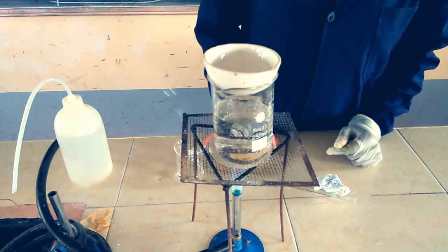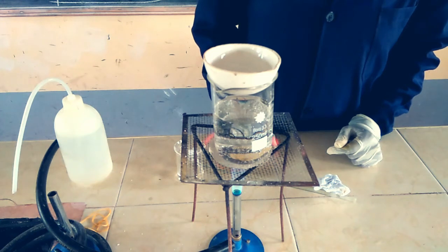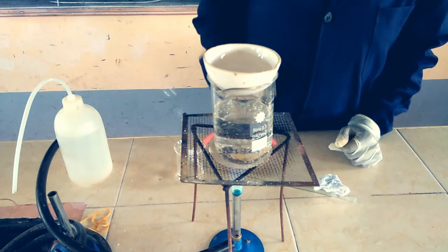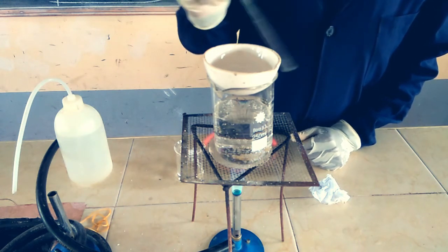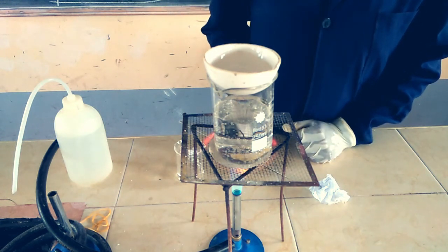Just give it enough time to evaporate so we can drive out all the water from our solid. You'll notice now there's no spitting out because we're not heating directly using the flame. Just allow it to heat. The water is already hot, so it is already heating the process. It won't take much time. There's no more spitting out, as you notice.